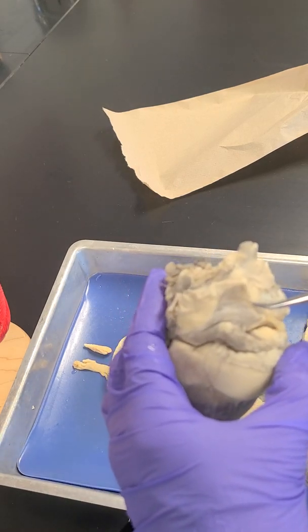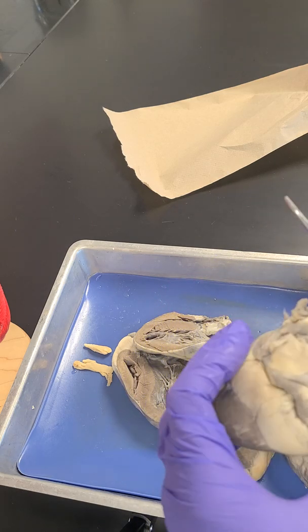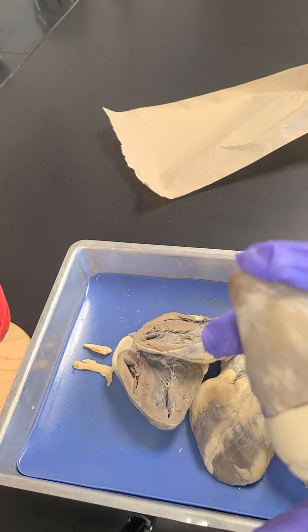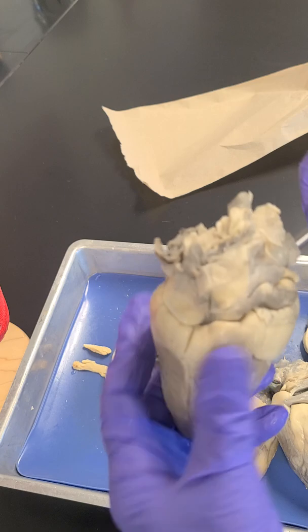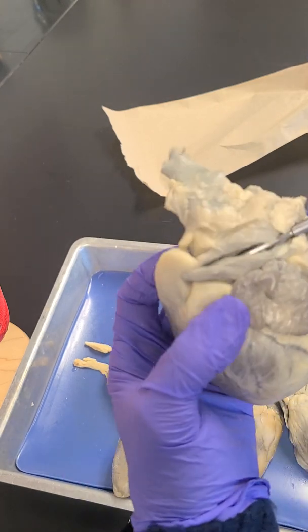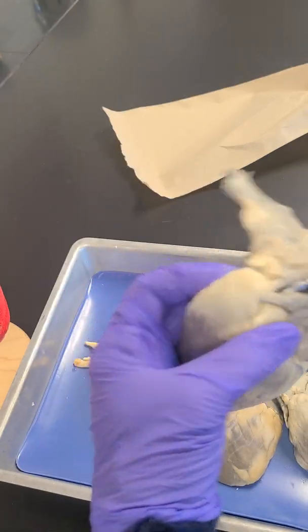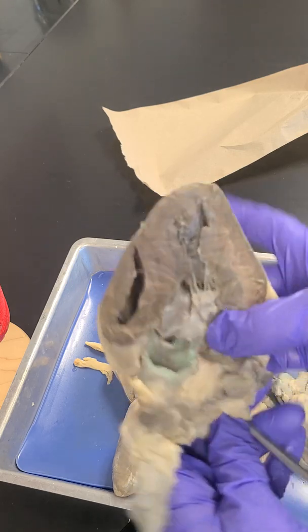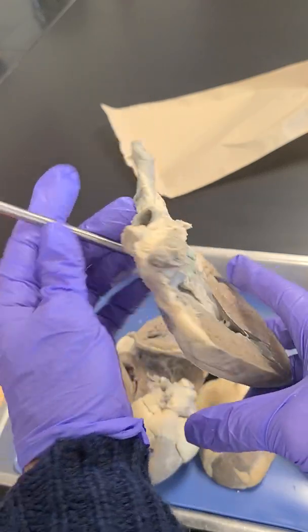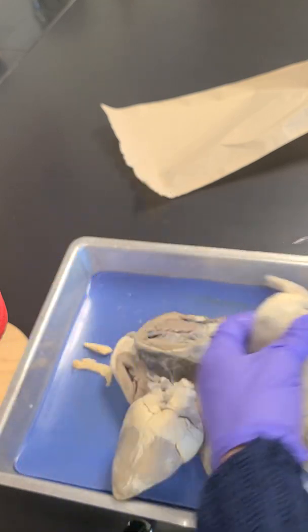And there's this vessel right here. You really can't see. Okay, so it's still this vessel right here. So this is the anterior surface of the heart. I want to know what vessel this is, and it goes in this chamber right here. Okay, so what vessel is this that comes across the front of the heart?